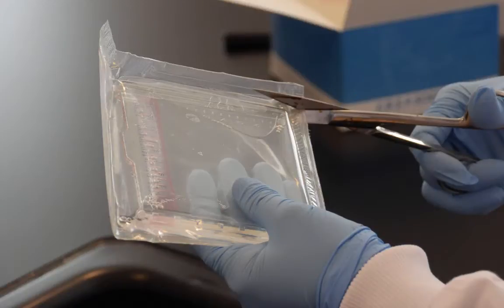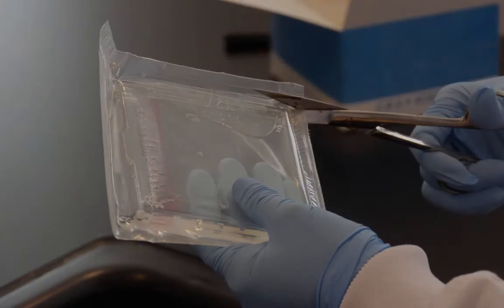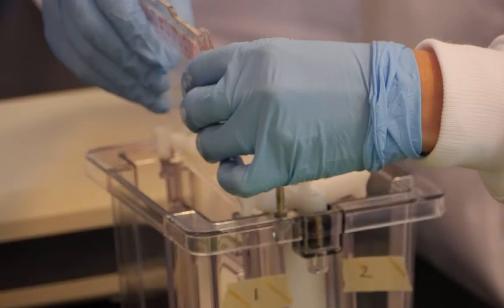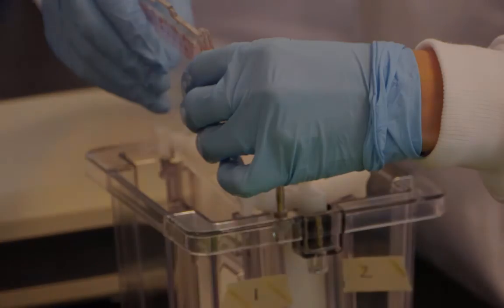The gel was removed from its packaging and carefully placed into the gel tank.